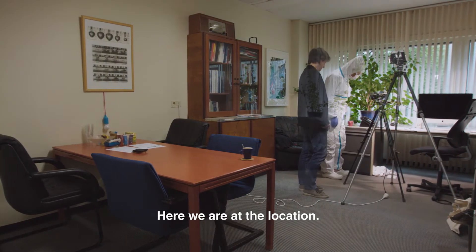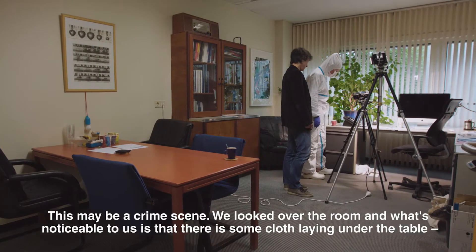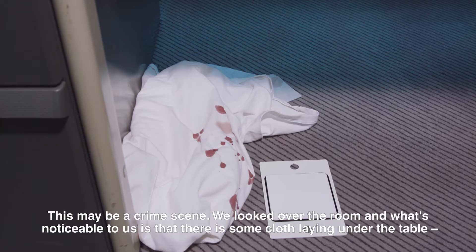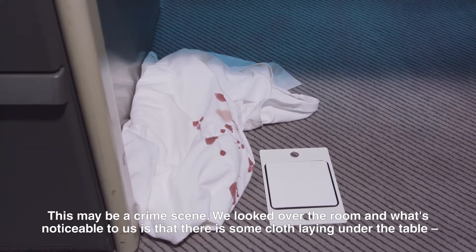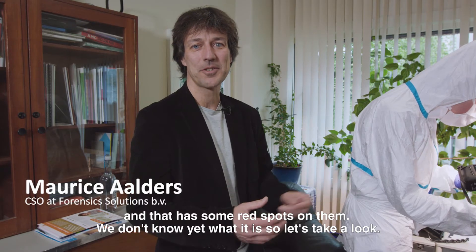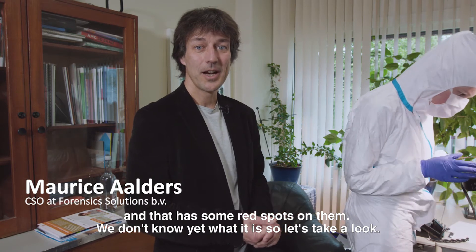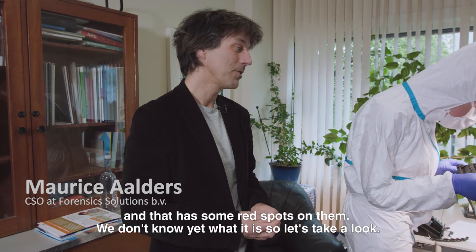So here we are at the location. This may be a crime scene. We've looked in the room and what's noticeable to us is that there is some cloth lying under the table, and that has some spots on them — some red spots. We don't know yet what it is, so let's take a look.